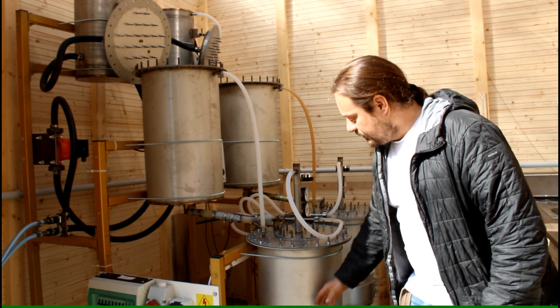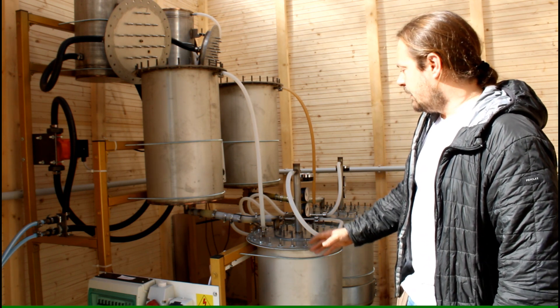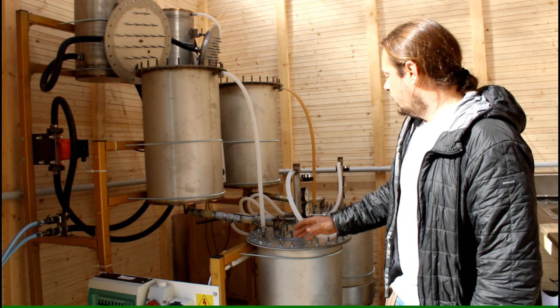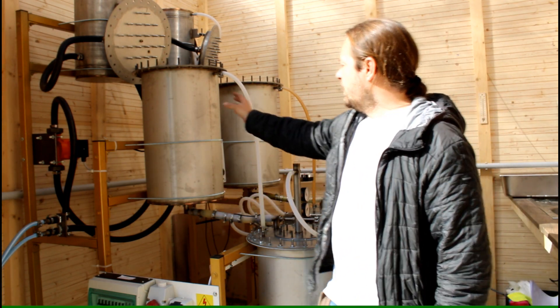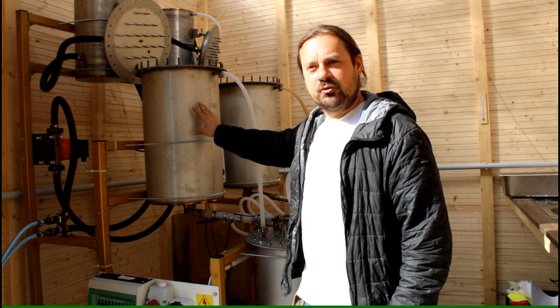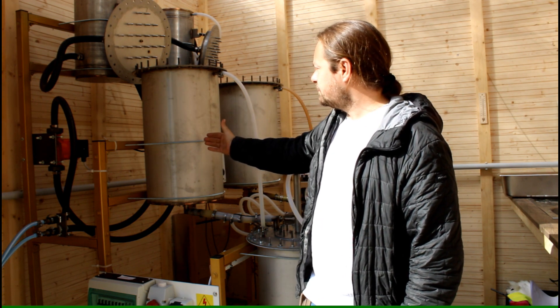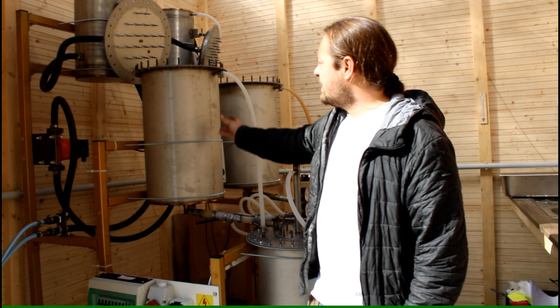And this will bring the solvent to a boil and the vapor will rise up here and of course also here. Here in this tube the herbs to extract are included and the vapor will subsequently rise up here.